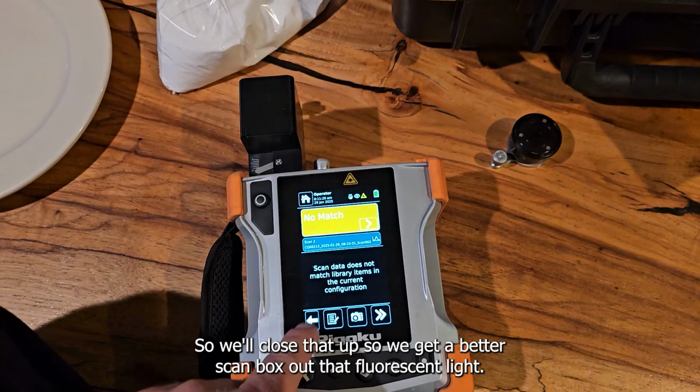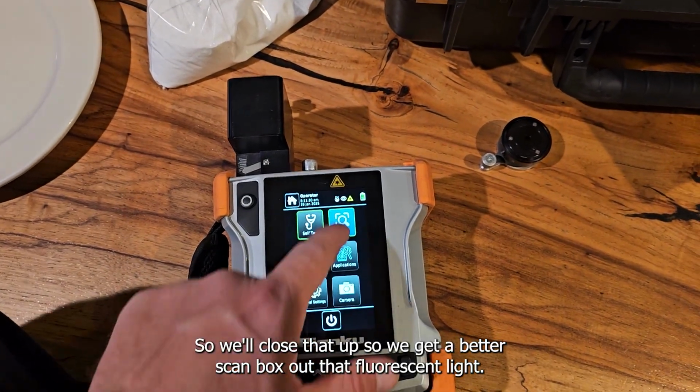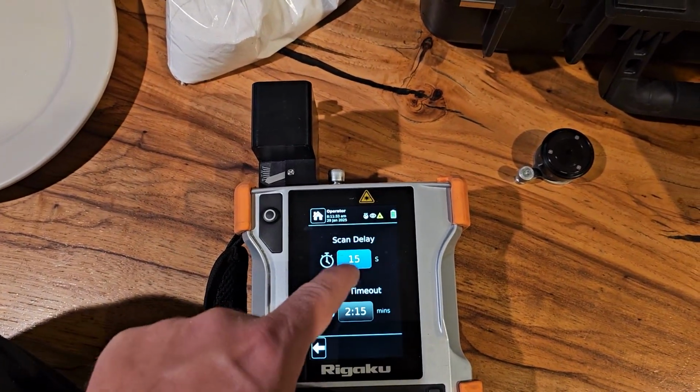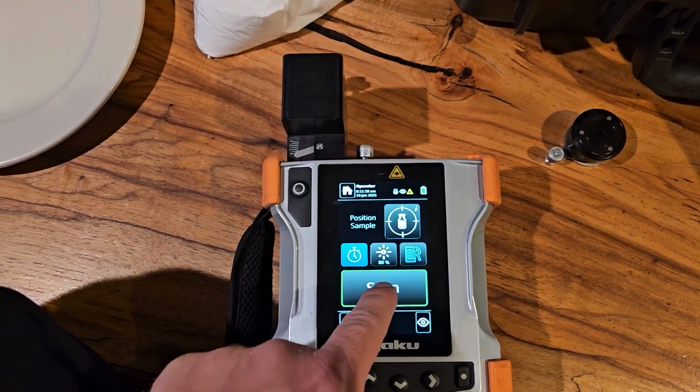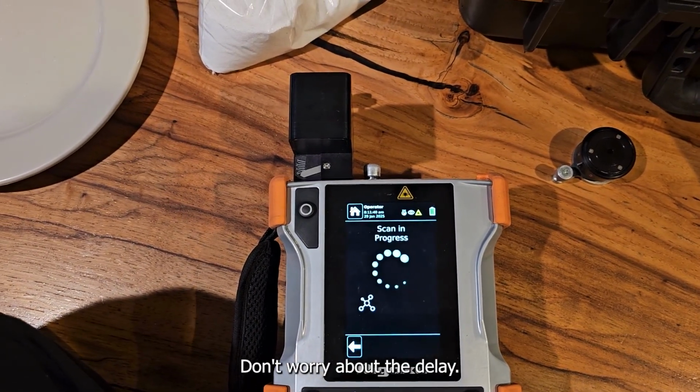So we'll close that up so we get a better scan, which blocks out that fluorescent light. Set this again to 0. Hit scan. Don't worry about the delay.